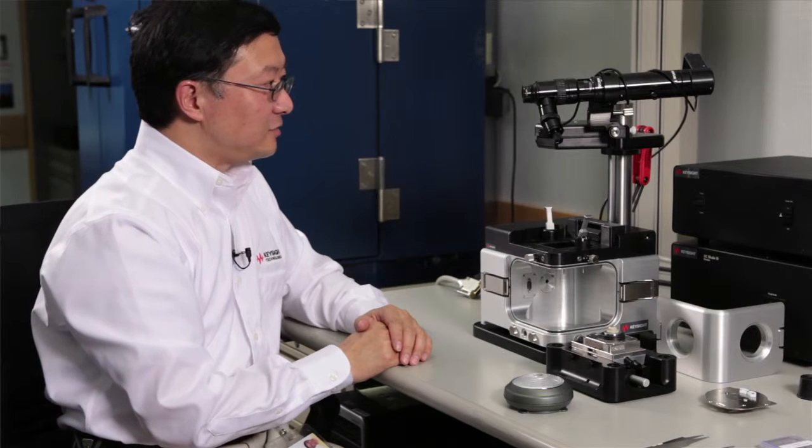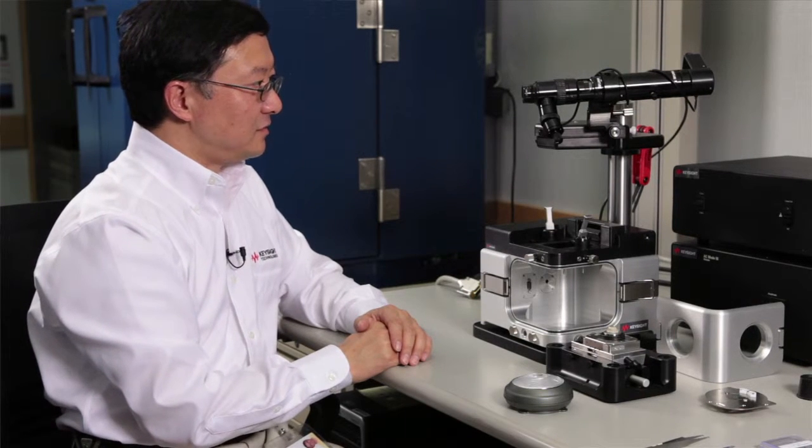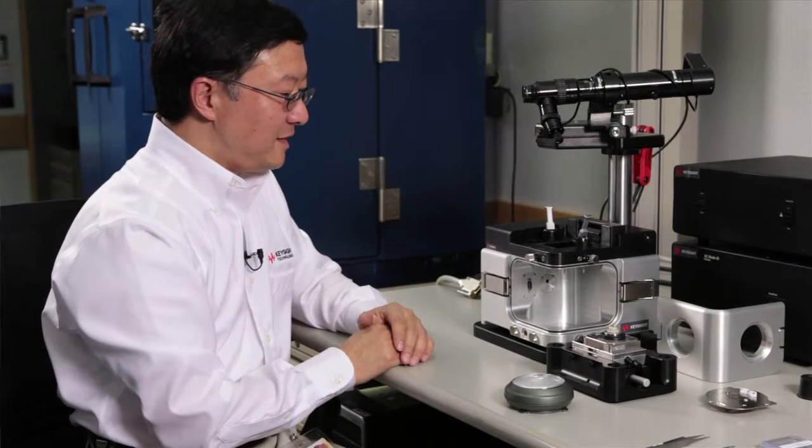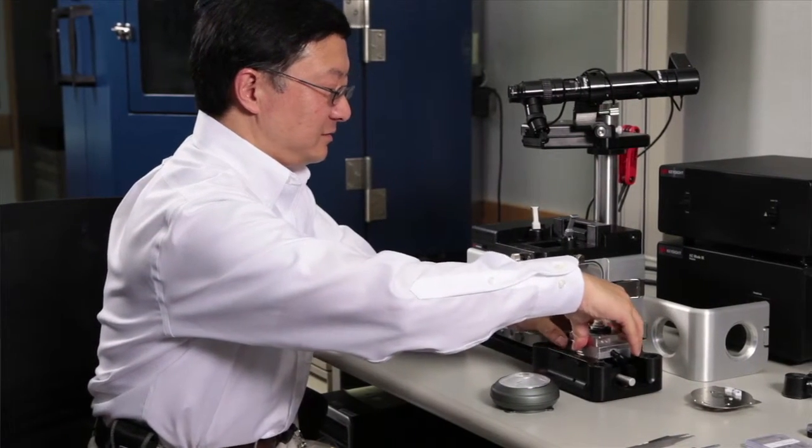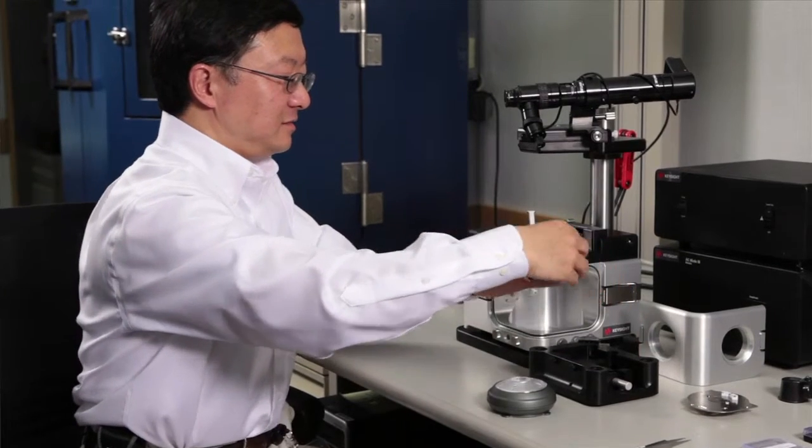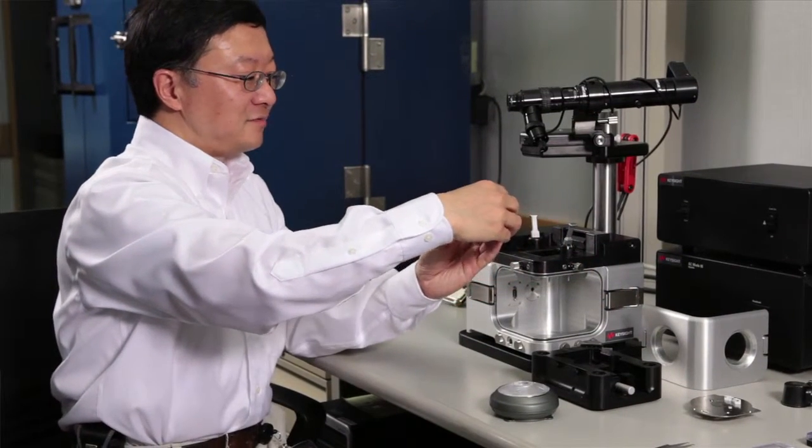The next step, in order to align and focus the optical microscope, we need to have the scanner and hopefully to have a cantilever on it which can allow you to have something to focus on.